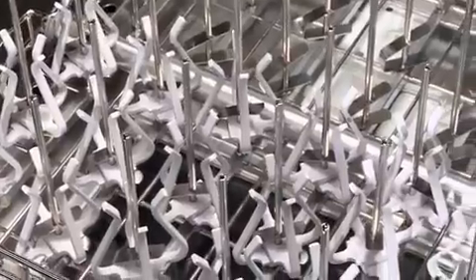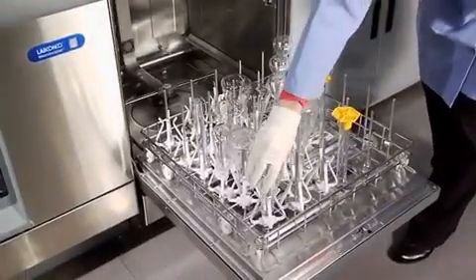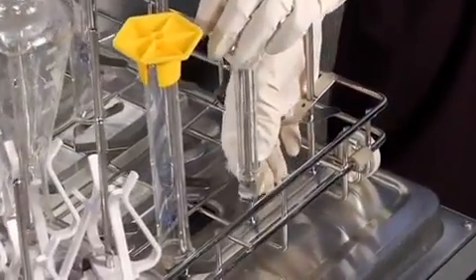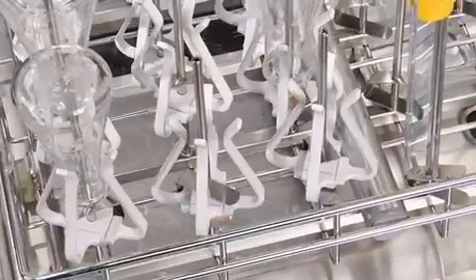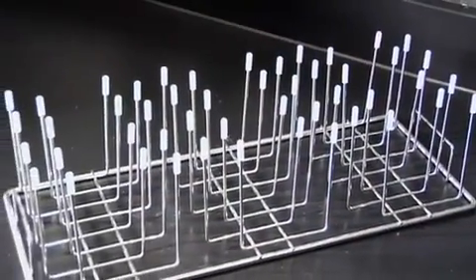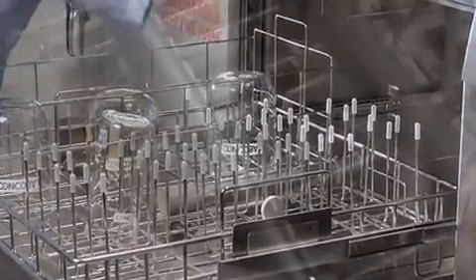The Flask Scrubber and Flask Scrubber Vantage series washers include a 36-spindle lower rack and 18 glassware holders. Place narrow neck glassware over the spindles using the height adjustment clips, raising the glassware so the spindle is centered within it, not touching it. Use the glassware holders to keep Erlenmeyers, small beakers, or BOD bottles positioned over the spindles. The accessory 48-pin insert occupies approximately one half of the spindle rack and may be placed directly over the rack with or without the spindles in place.